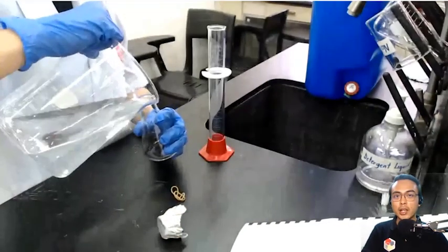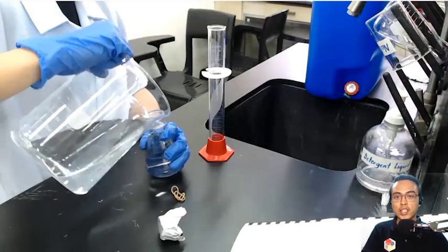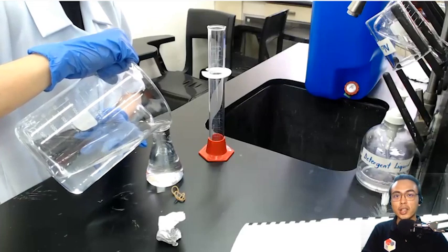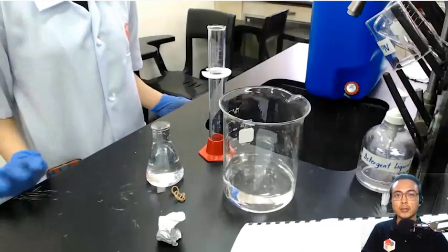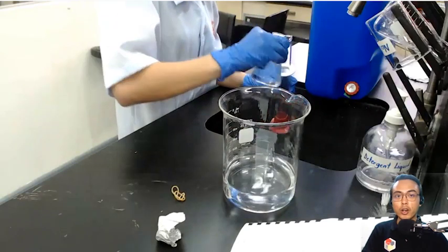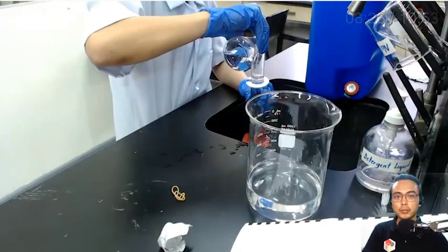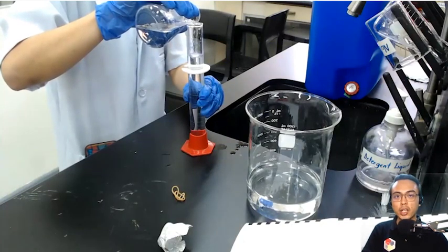Now we will be determining the volume of the flask. So as I've mentioned earlier, we can determine the volume of the flask by filling it with water and then measuring the total volume of the water inside the flask. Because the total volume of the water inside of the flask would also be the total volume of the space inside the flask. Okay? So you see here that the Erlenmeyer flask is now full of water, and we are using a graduated cylinder to gradually measure the amount of water inside of the flask. The volume of the flask is given in your raw data.